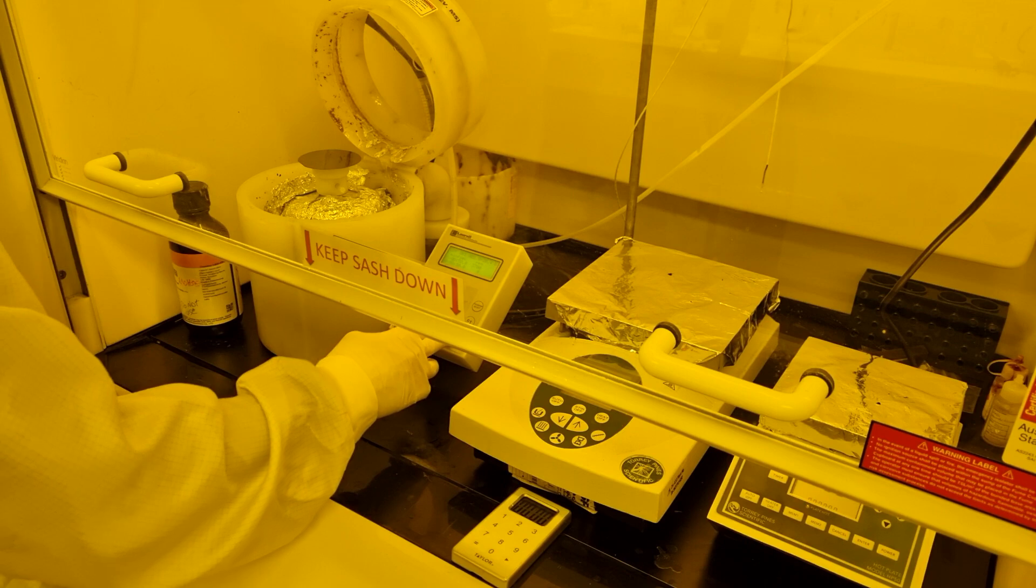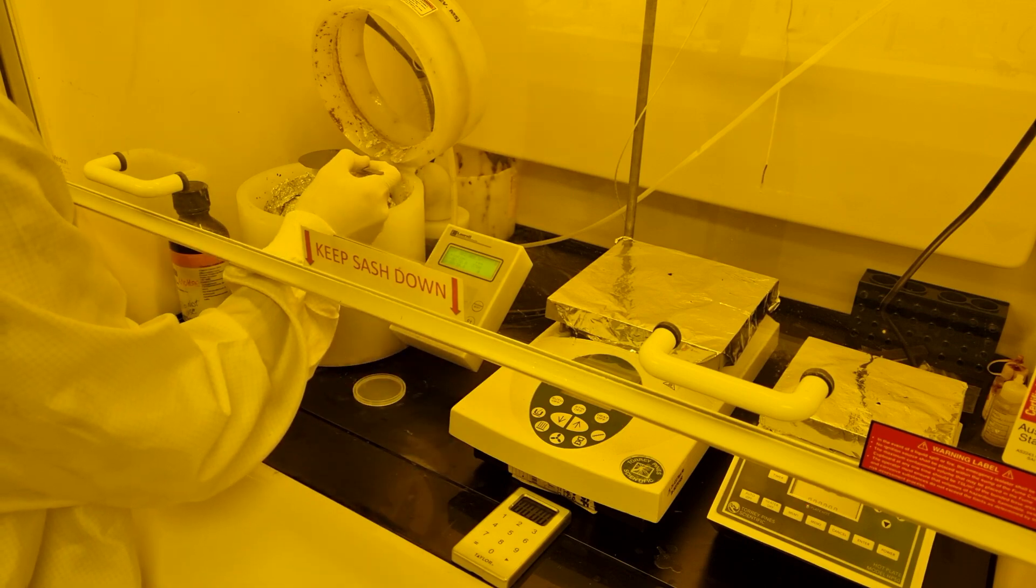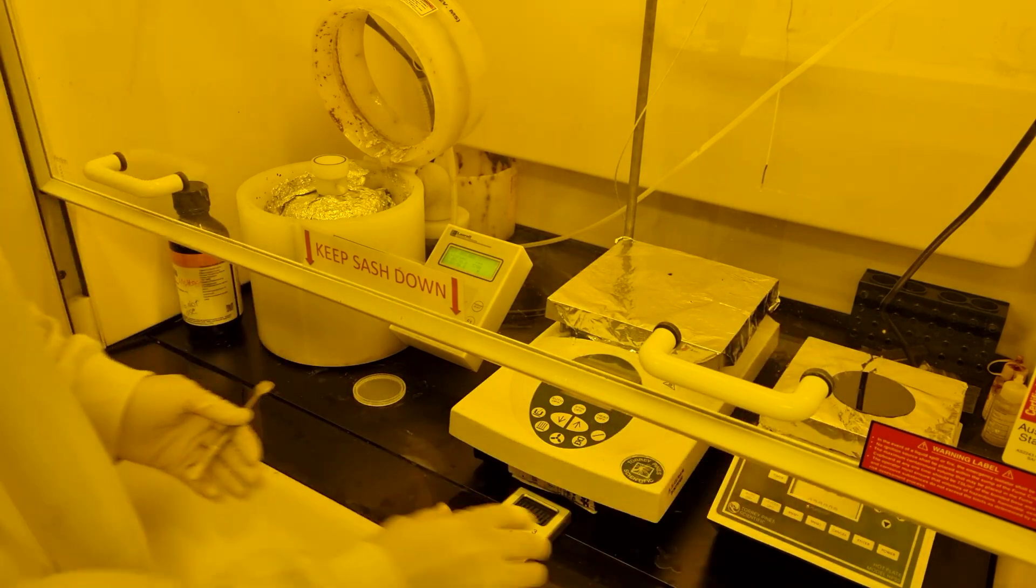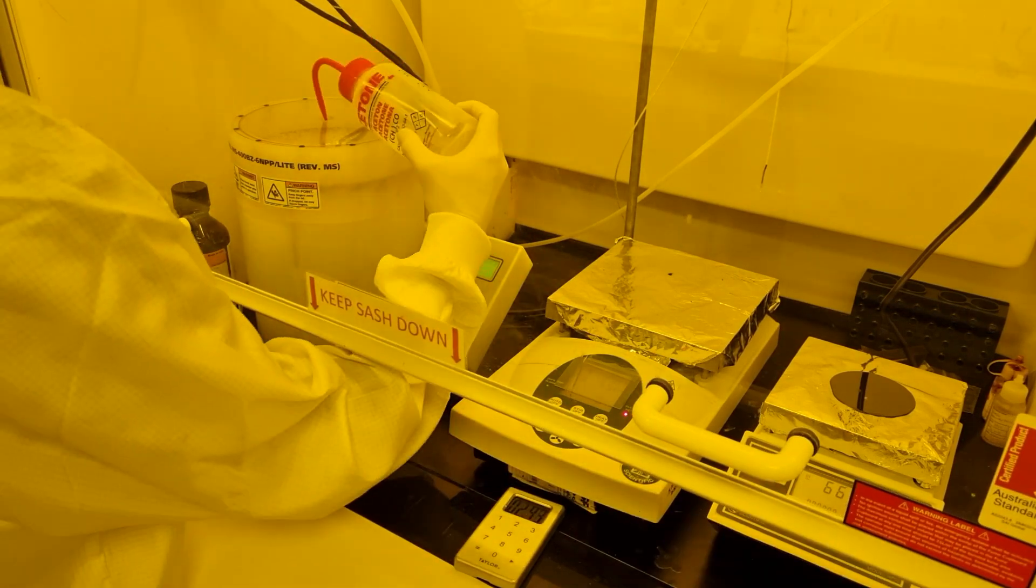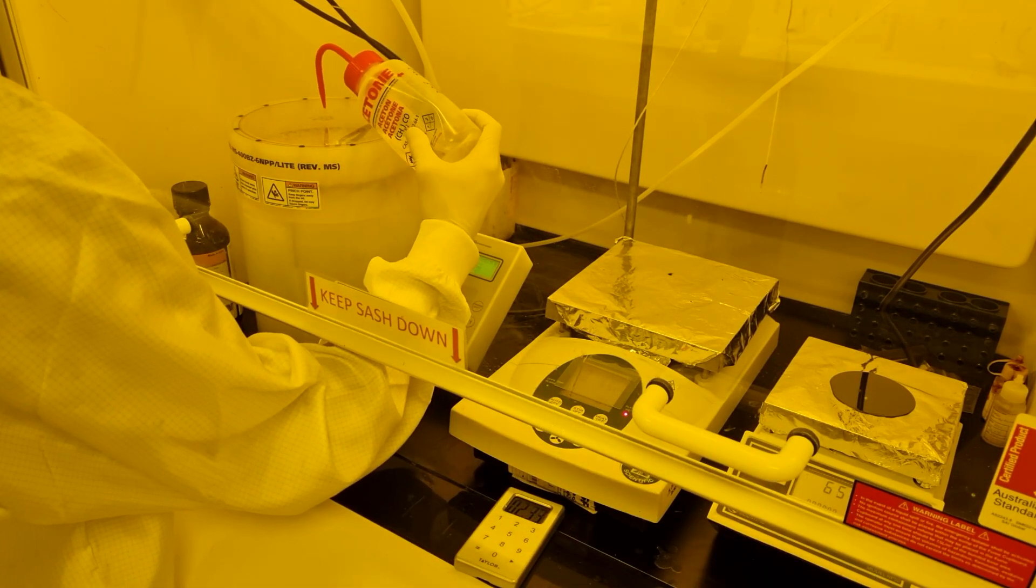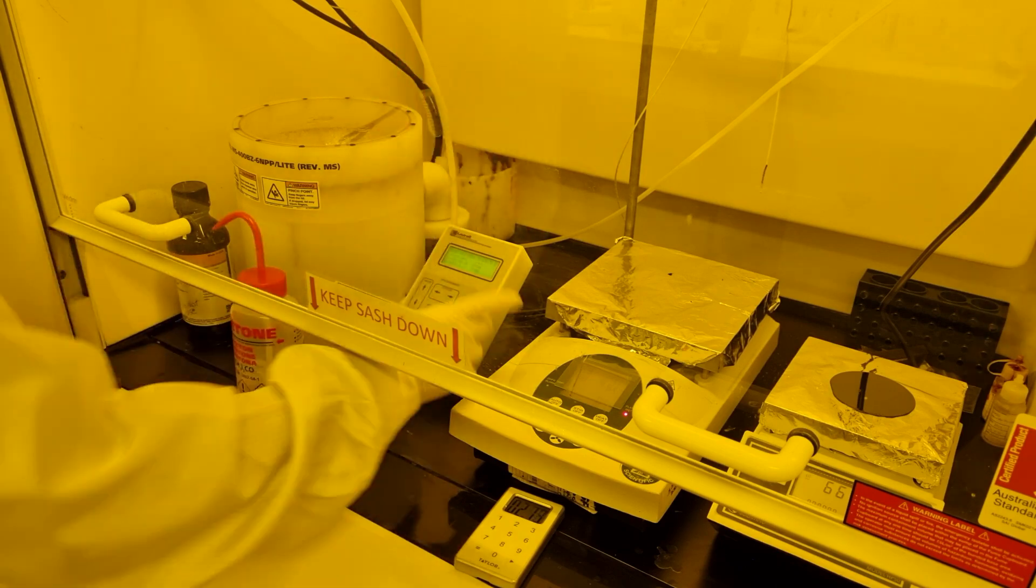If your first coating isn't good enough, wash it off now with acetone and 2-propanol, then start again at the plasma clean. If it's okay, move the wafer to the 65 degree hot plate for the suggested time, then move it to the 95 degree hot plate for the suggested time. If you're using foil covered hot plates, it's probably good to add 3-5 degrees to this set point to compensate.